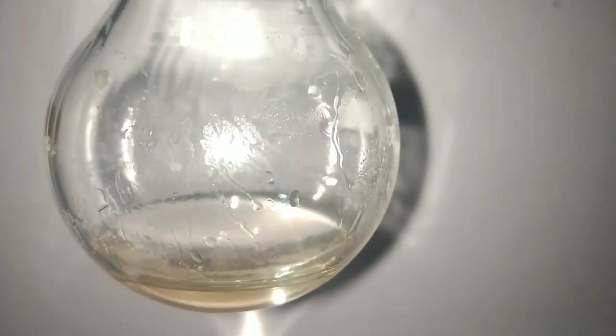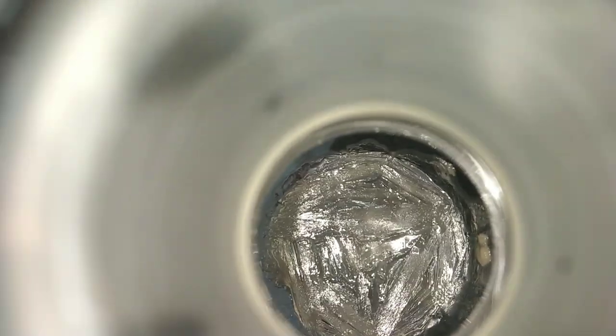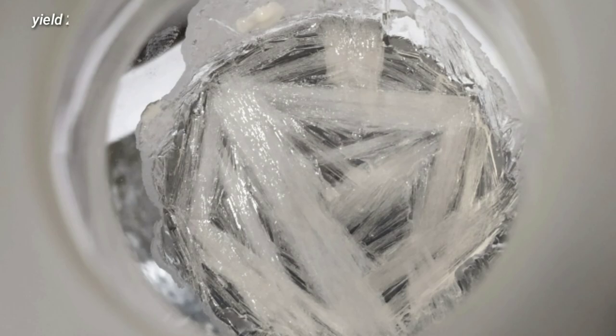The clear solution obtained after warming the alcohol mixture was then set aside for cooling. On cooling, needle-shaped crystals of a much purer form of cyclohexanone oxime were obtained.